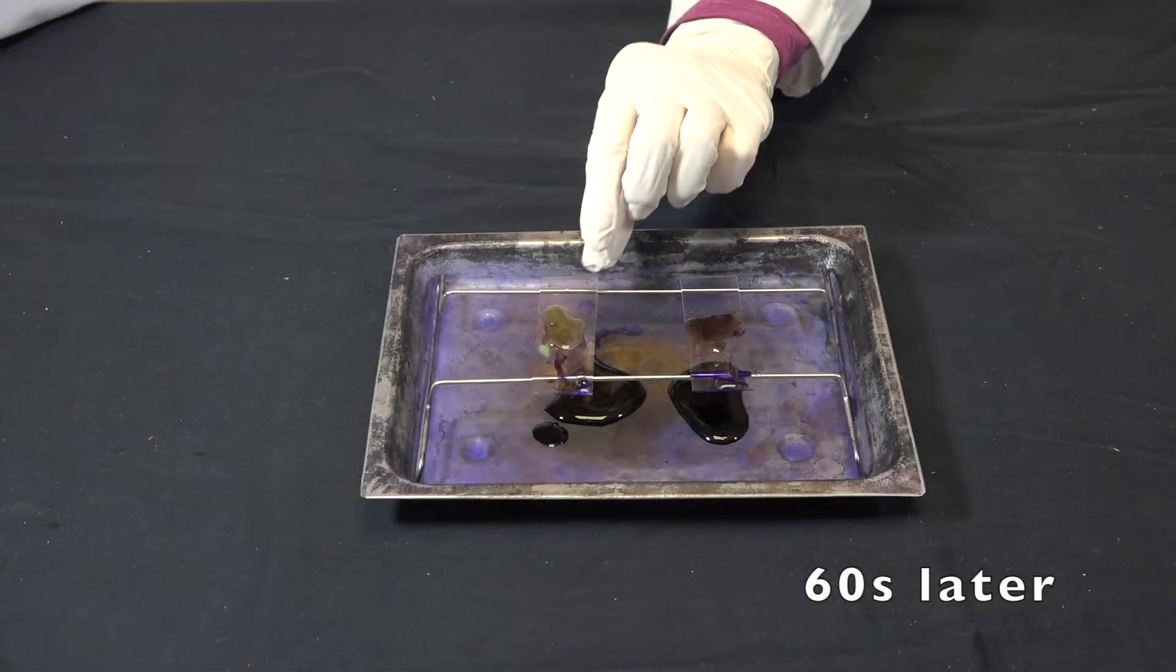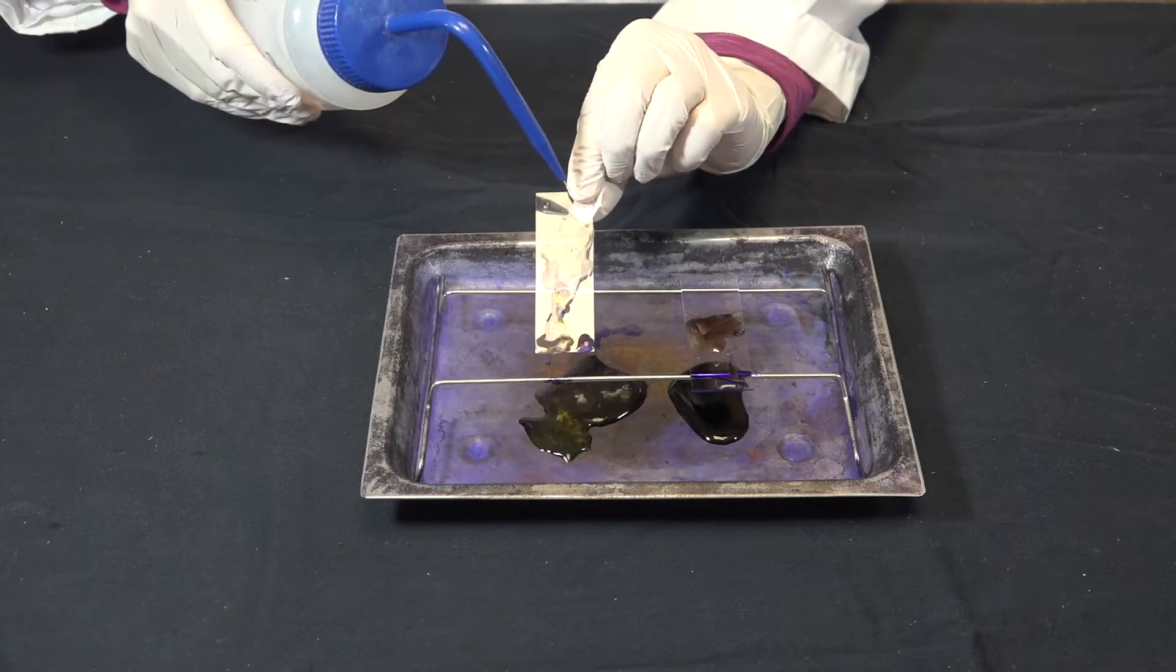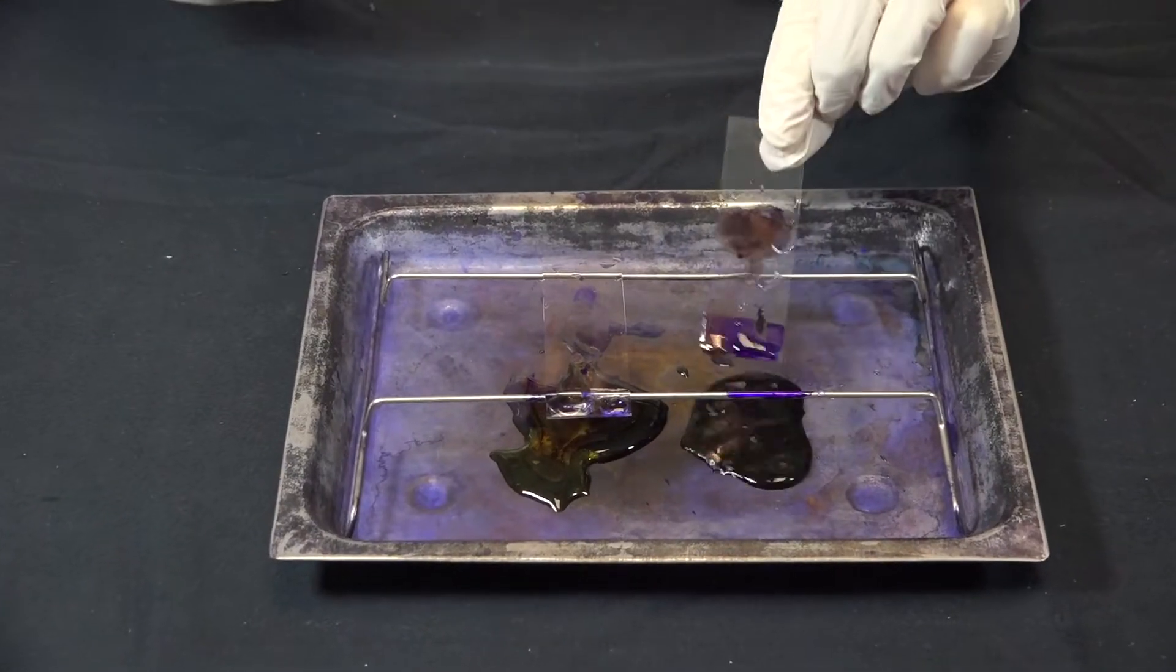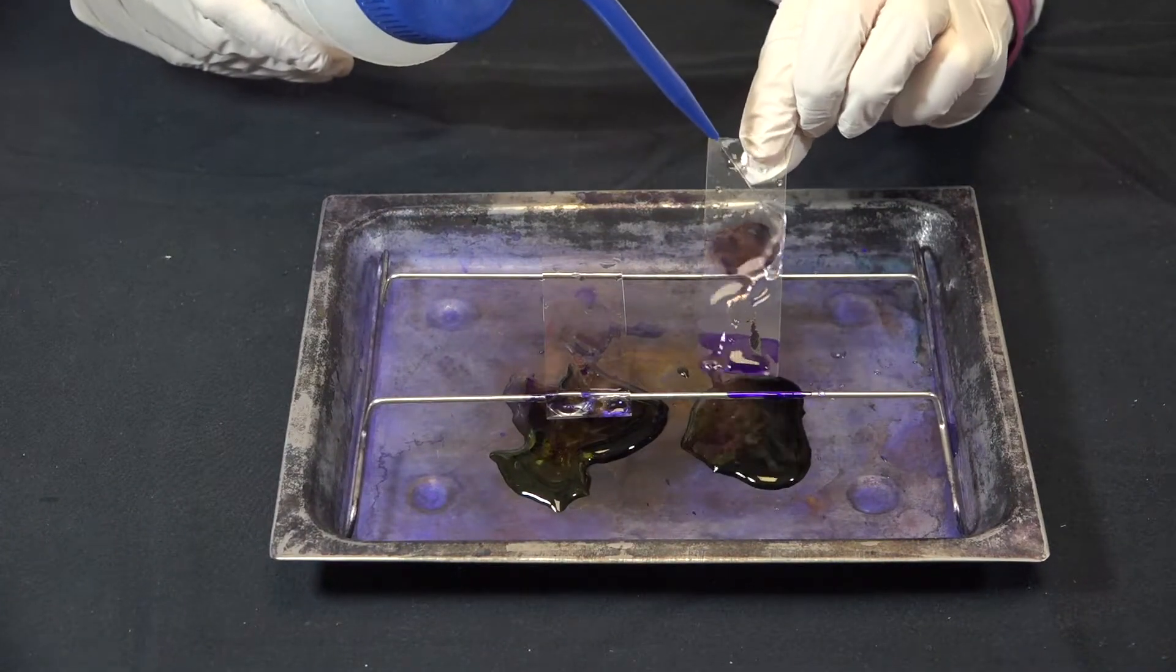Now we're going to rinse off the excess iodine with distilled water again. Just like before, let the water run over the smear. Don't spray directly on the smear.